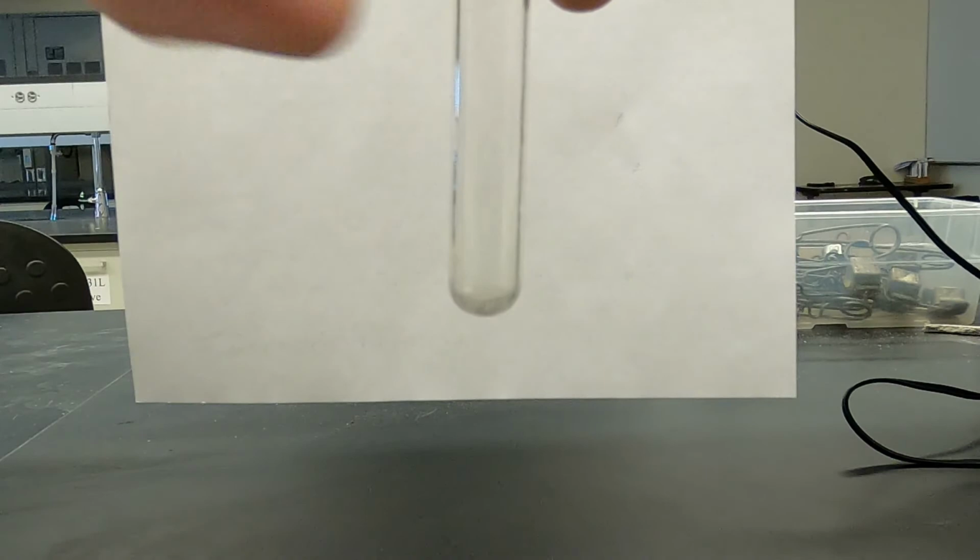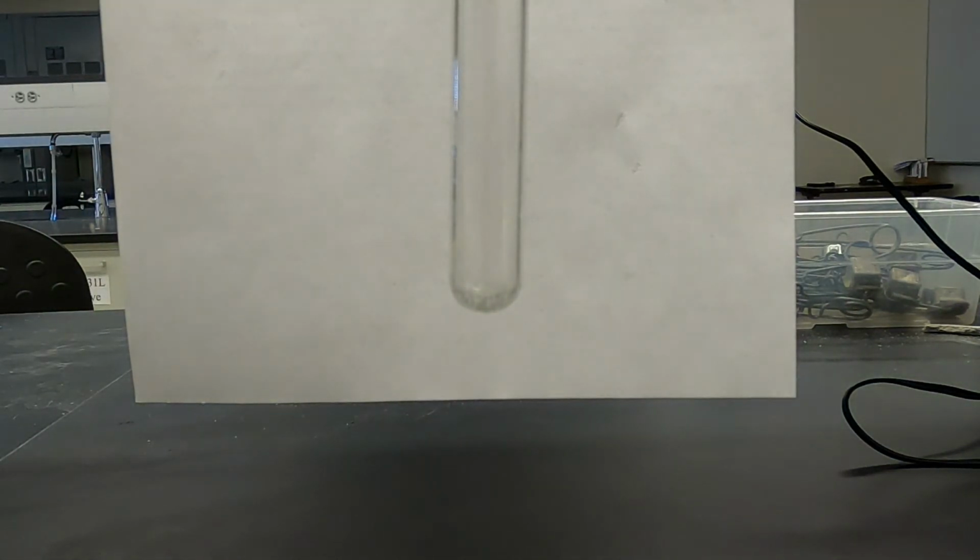And our last sodium phosphate mixture will be with potassium carbonate. Not much to see there. Nothing to see here. Move along.